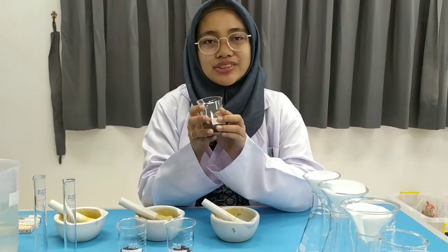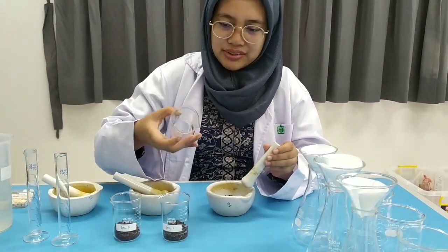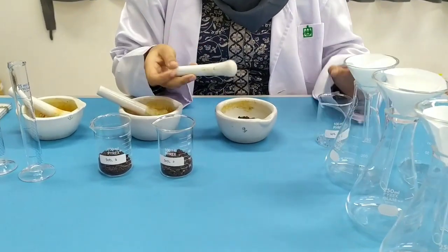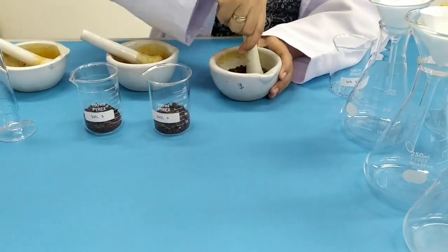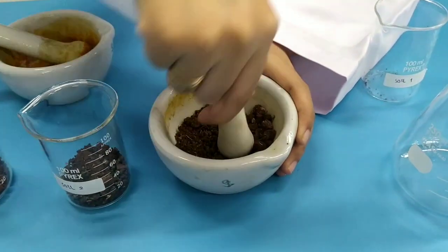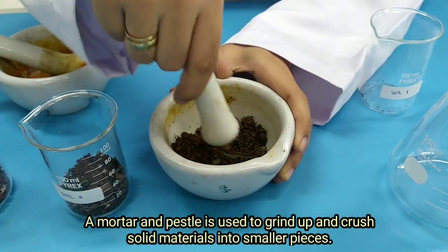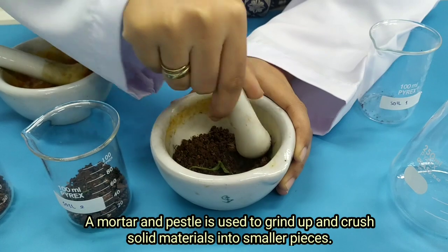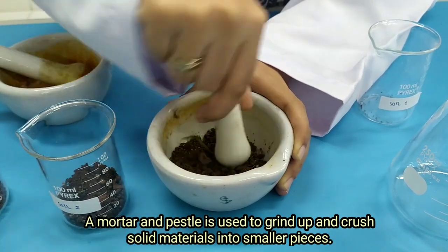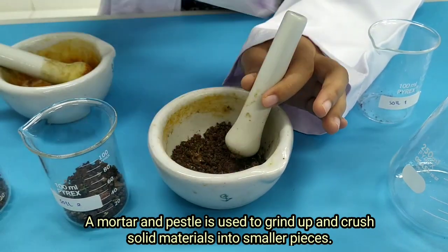Now we will go to the experiment. First, we will pour soil one into the mortar, and then we will crush it using the pestle. We will make sure all the particles become soft. I will remove the plants first.